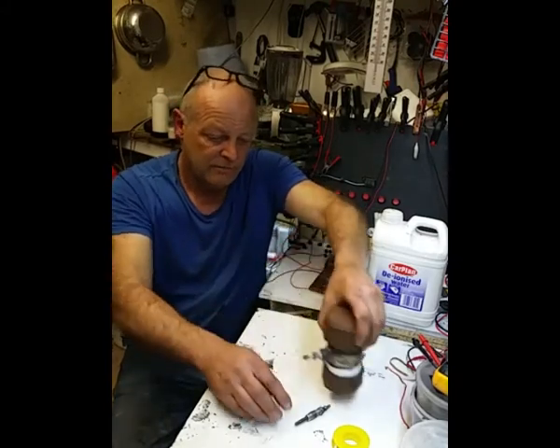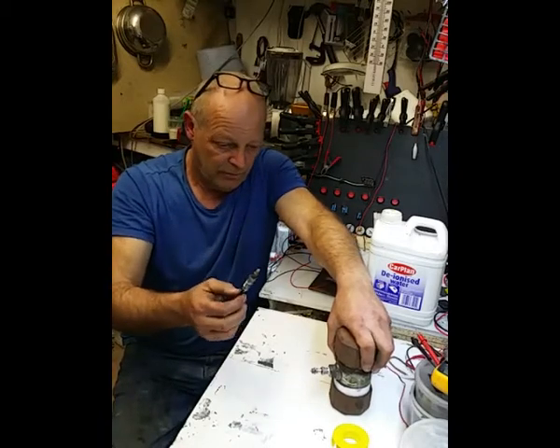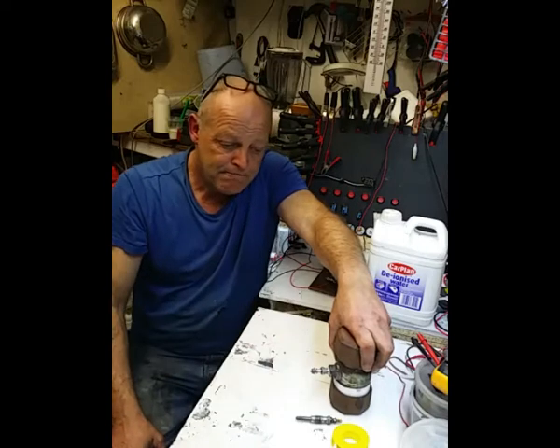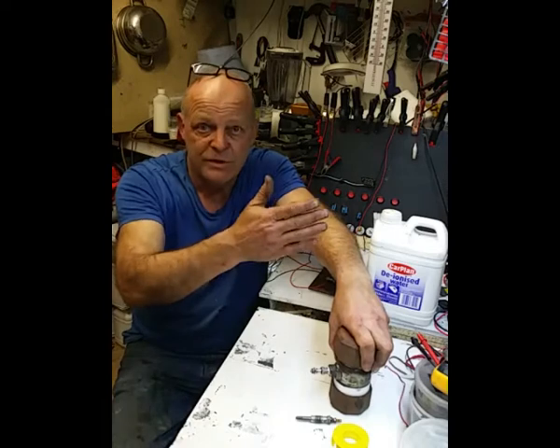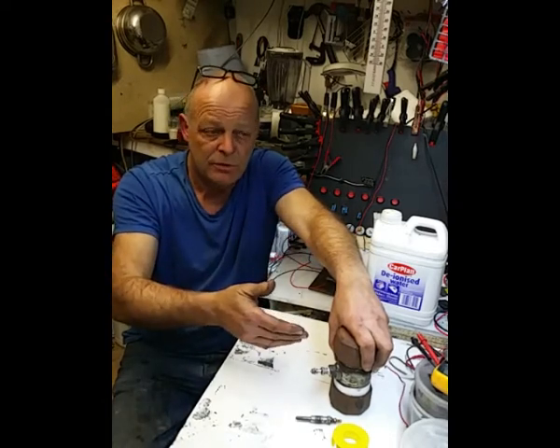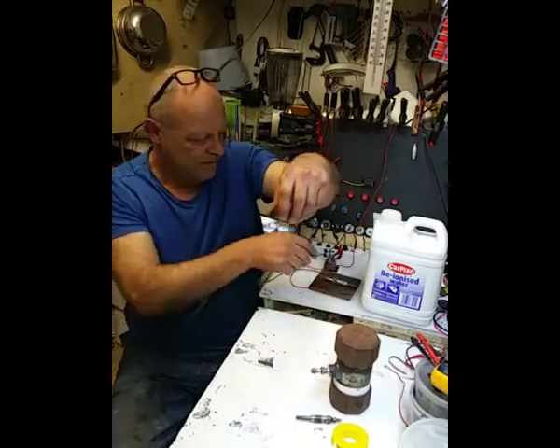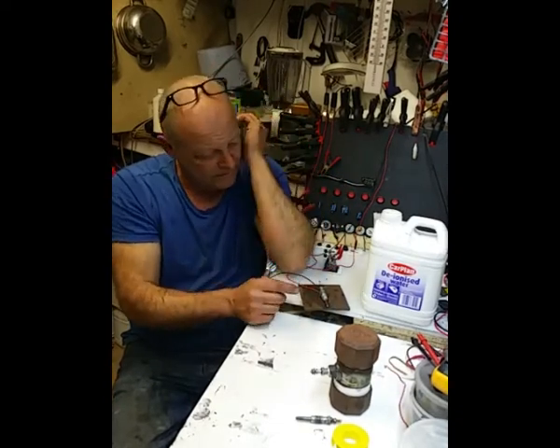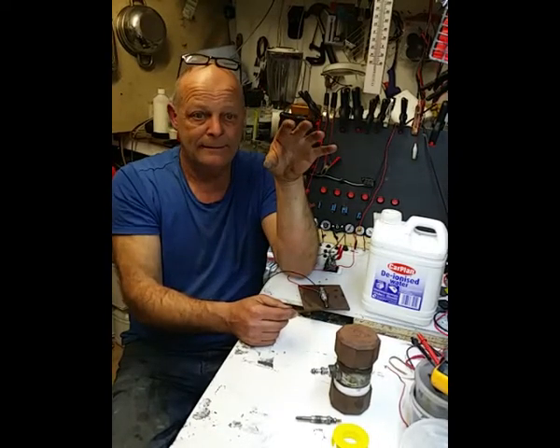Now these things you can control the temperature by just putting the DC voltage in, and obviously at a certain voltage, a certain current level, you measure the temperature. That's it in a nutshell. Simple. Now this one I've got sitting there on a piece of metal. It's wired up, ready to go. So let's give it a go.